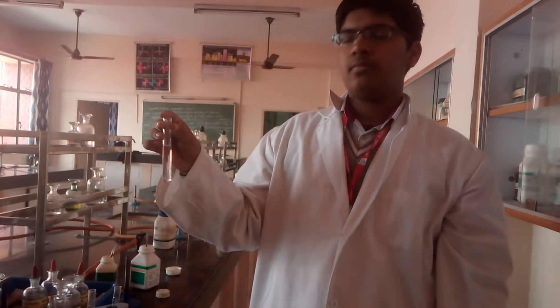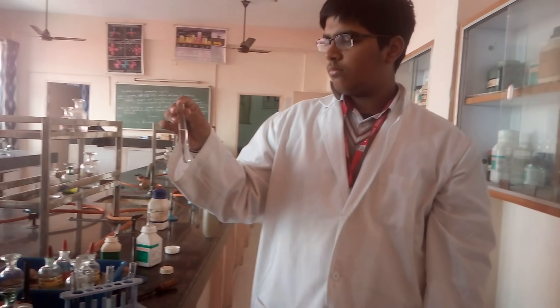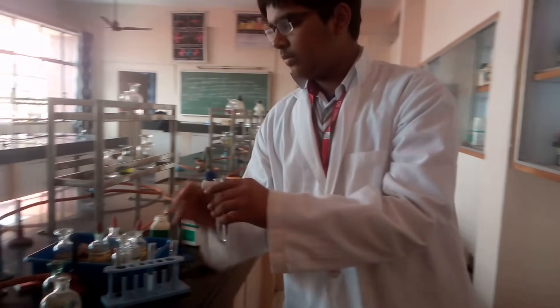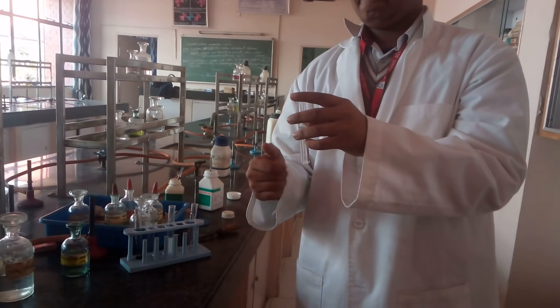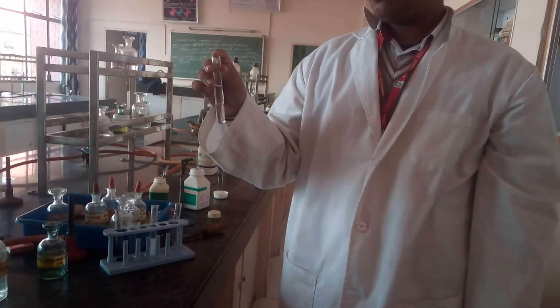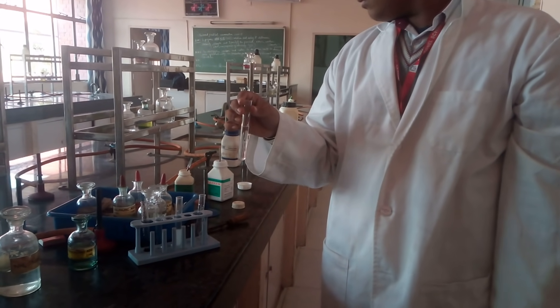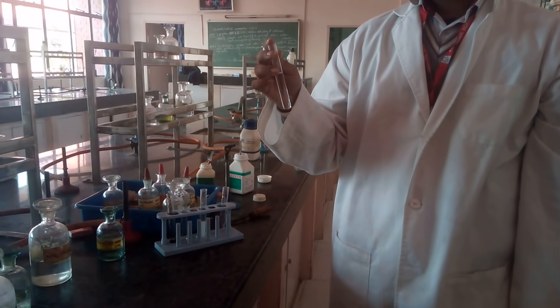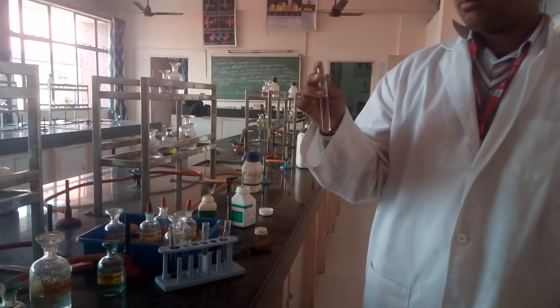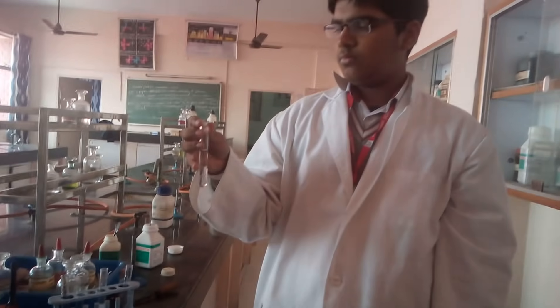So we have done two tests: one with barium chloride and the second with lead acetate. This is the way you confirm the sulphate ion in your salt. Mind you, if you get sulphate, the cations will not be from Group 1 — that is lead — and not from Group 5 — that is barium, strontium and calcium. Don't make the blunder of saying your salt is lead sulphate, barium sulphate, strontium sulphate or calcium sulphate, because these salts are insoluble. With sulphate you would never have Group 1 and Group 5. Thank you, Karan.